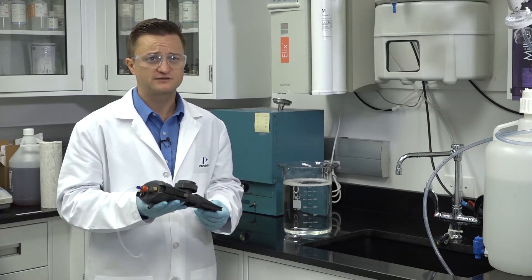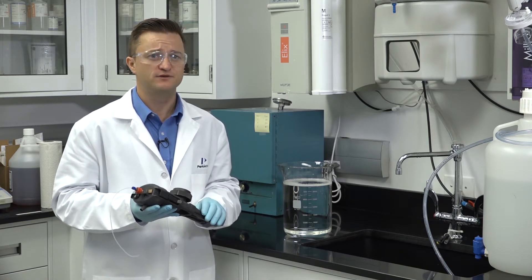How often you clean the burner assembly or burner system depends on the nature of the samples you are analyzing.